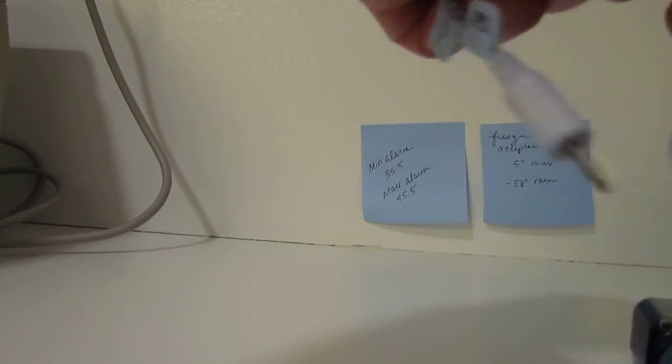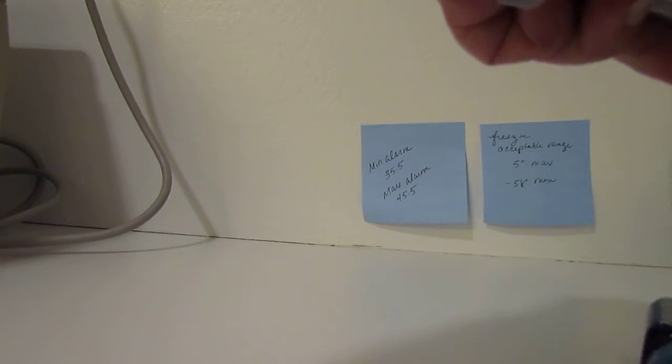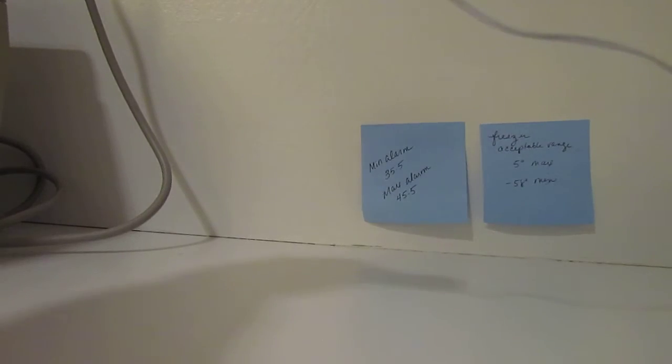So you got plenty of cord here but I mounted mine towards the top so it will be on the outside of the refrigerator and in the room.